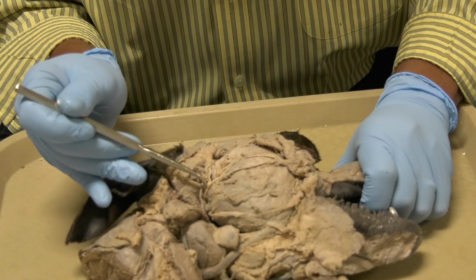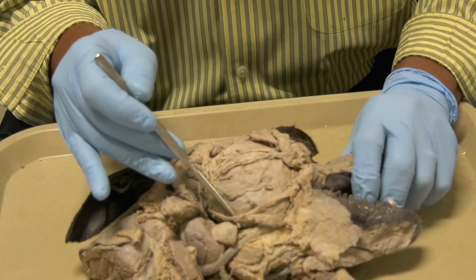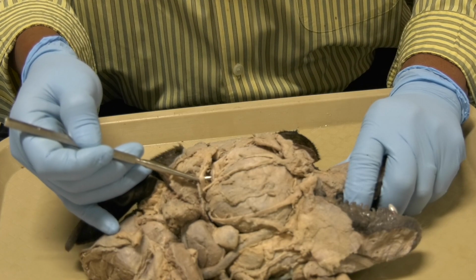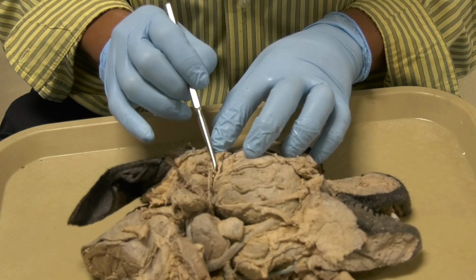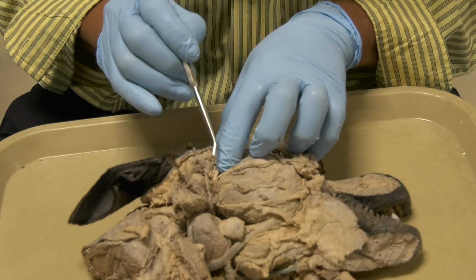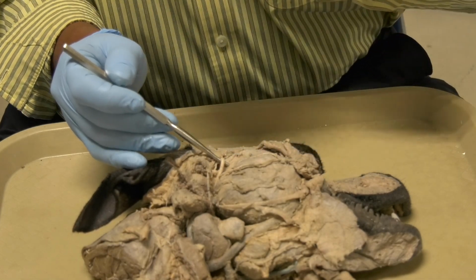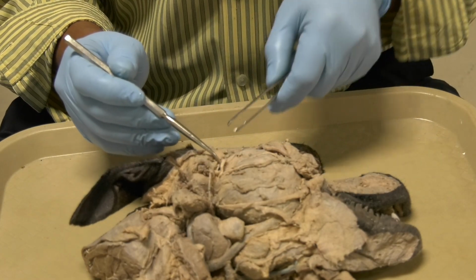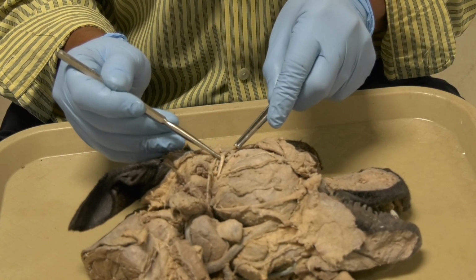It comes and it gives the dorsal and the ventral buccal, okay, and also it gives the auriculopalpebral that divides into an auricular branch, which is this one here, that goes to the ear, and a palpebral branch that goes and continues to the orbicularis oculi. This is the rest of it here, okay. It is being cut from there.